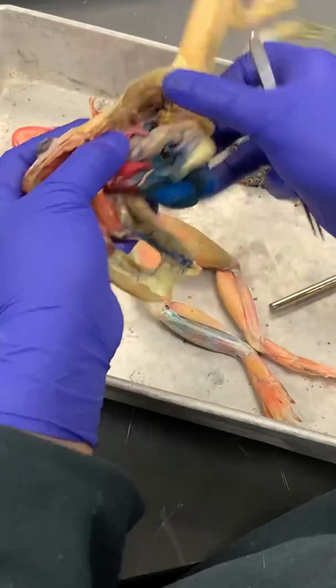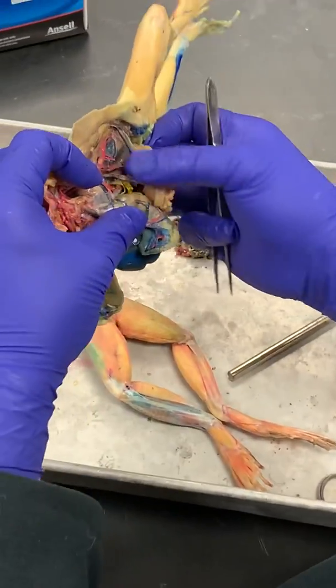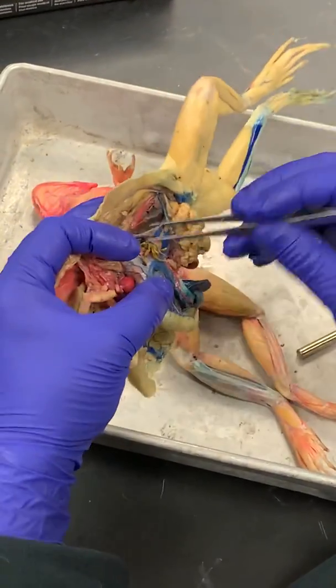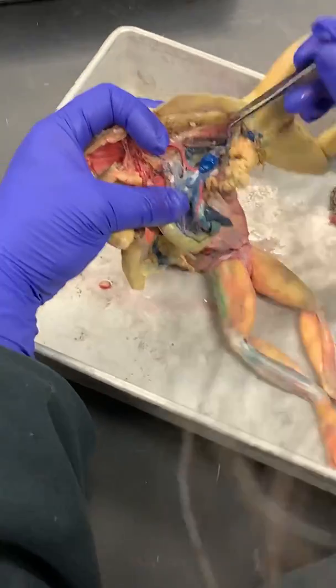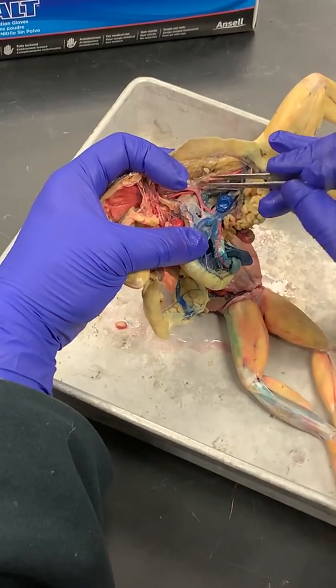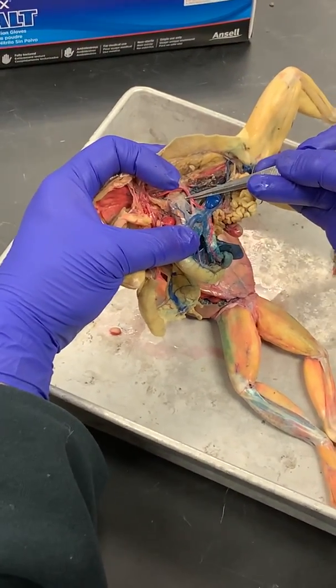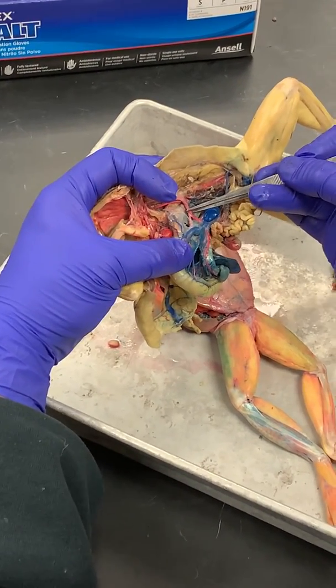Okay, look, I have everything peeled off and I'm underneath the kidneys. Stomach's up here. I'm going to stretch it out. There's my spleen. Right after the two systemic arches come together to form this dorsal aorta, there's a huge branch off of it. And this is called the celiaco-mesenteric trunk.